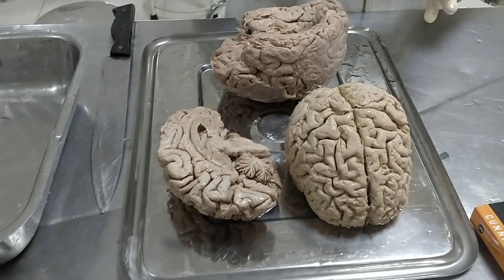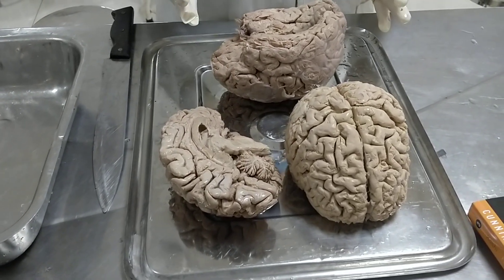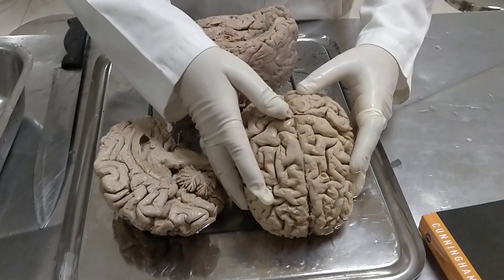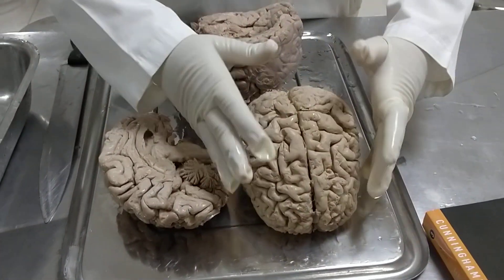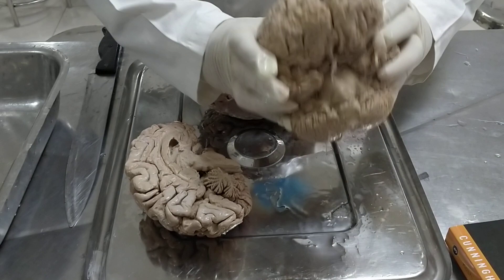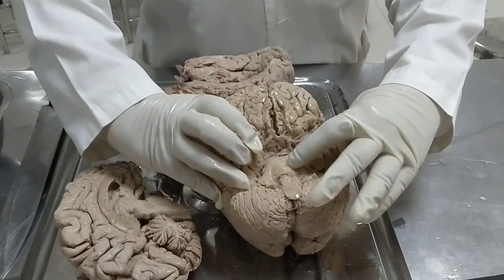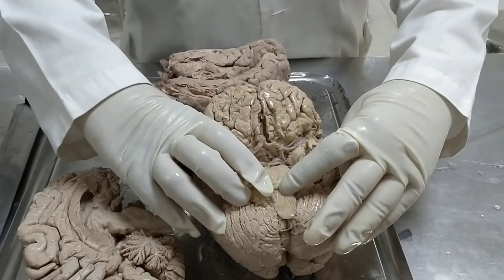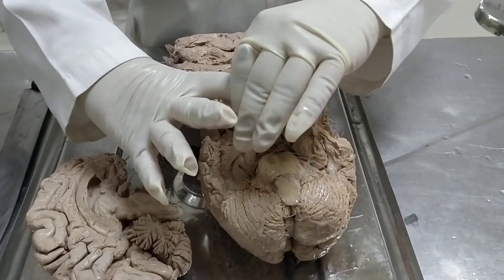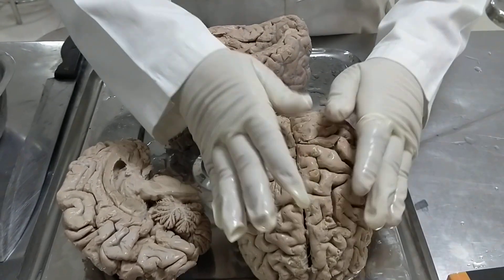So students, today we are cutting sections of the brain. This is the whole brain. This is the dorsal side of the brain and this is the ventral side. If you see from this side, you can see the brainstem — the medulla, pons, and midbrain. Also the circle of Willis on this side. So this is the dorsal side of the brain.